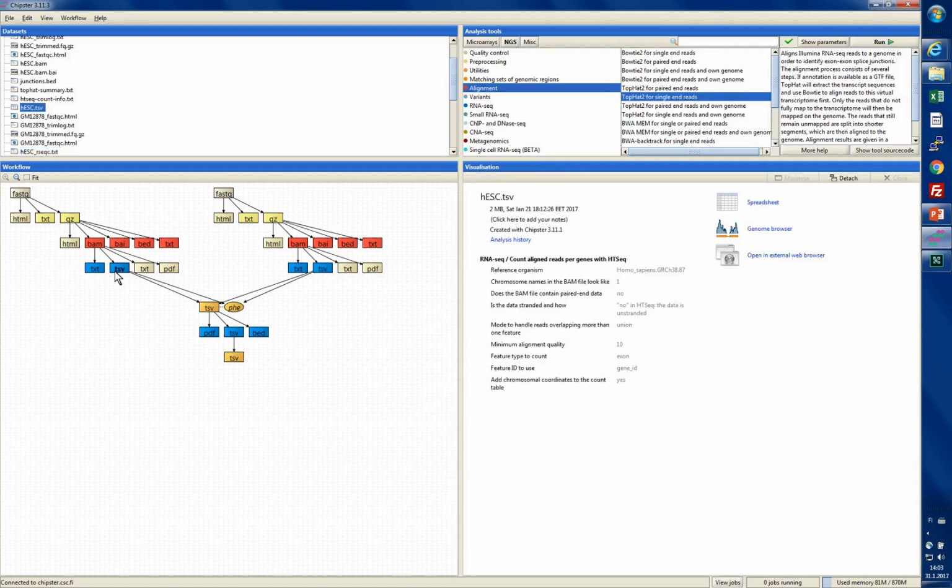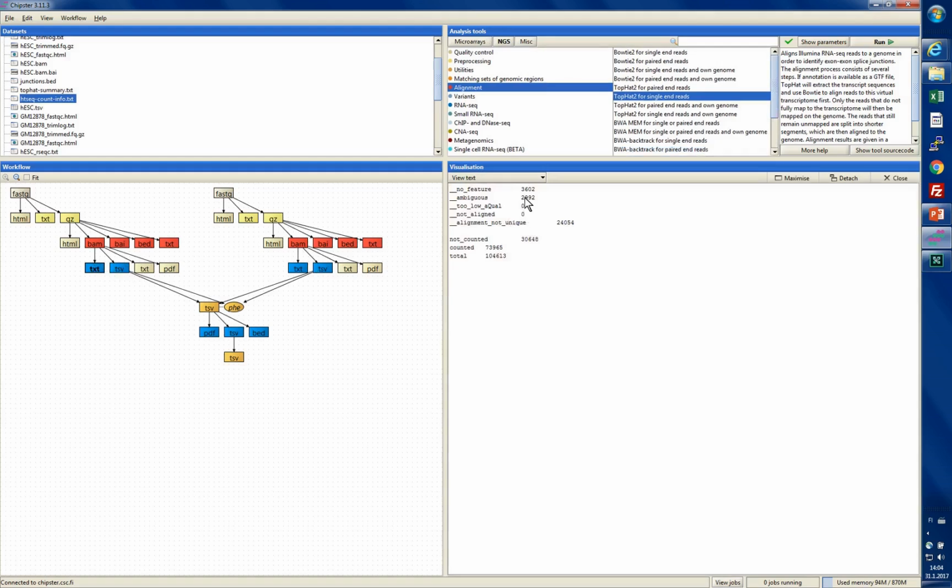Then we did the HT-seq counting of aligned reads part as well. And there I was asking how many alignments were not counted for any gene. For that one, you would need to open again the text file. Here we go. So this is the number of alignments that were not counted for any gene. Here you have the summary. Totally you had this many alignments, and out of them 73,900 and something were counted for some particular gene, and the rest of them were not counted for any gene.